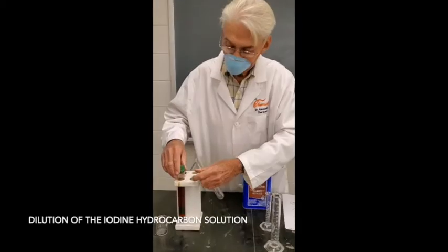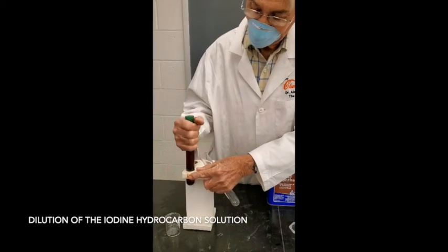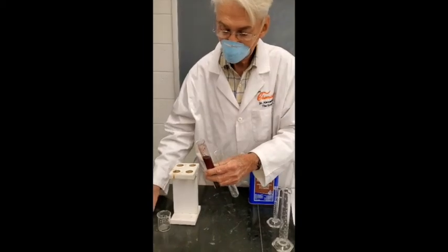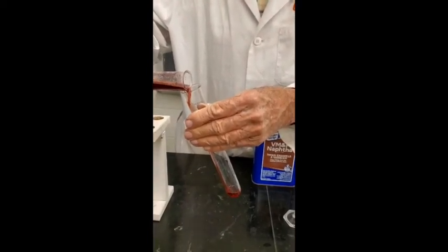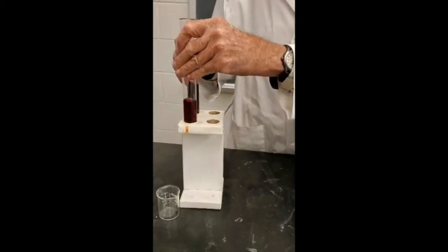Okay, everybody, what I'm going to do is pour a little bit of the hydrocarbon layer off into this other test tube and dilute it some more so I can see the color of iodine better, because iodine is so pretty you need to see it. Now I'm going to dilute it a little bit more and you'll be able to see it.